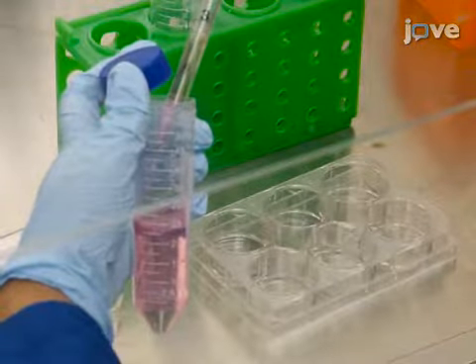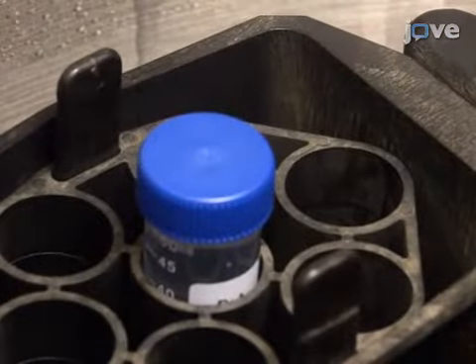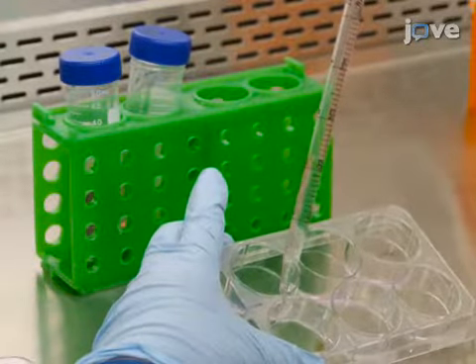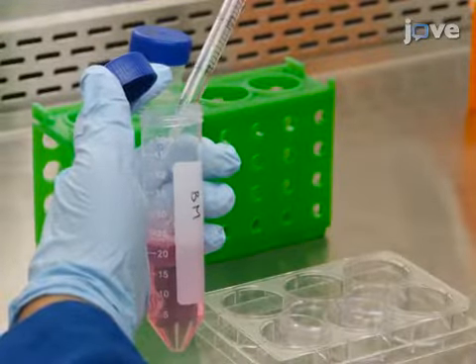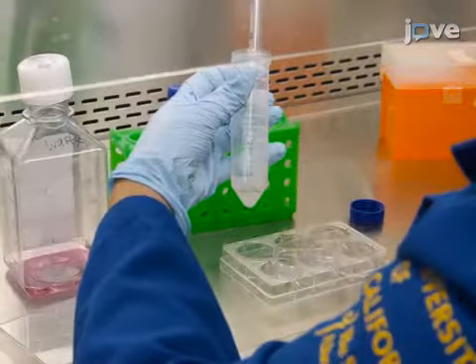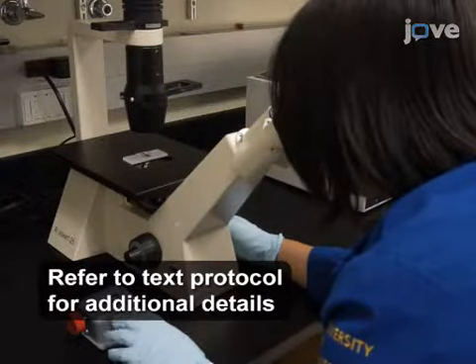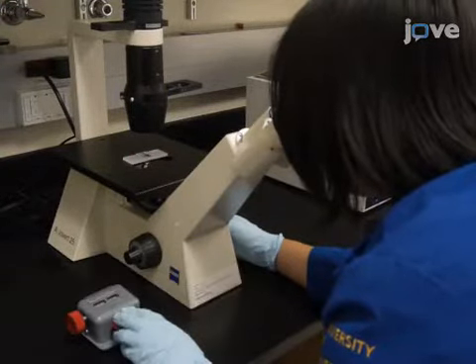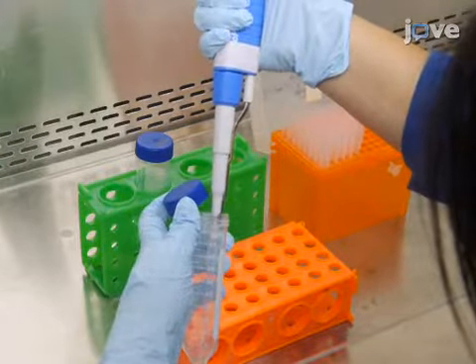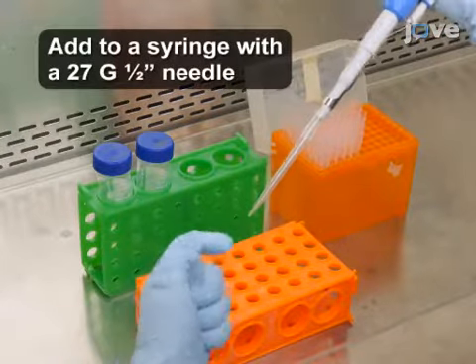Then add the cells to the respective tubes and pellet at 400 times G and 4 degrees Celsius for 10 minutes. With PBS, wash the cells again. Then, after spinning, use 5 milliliters of PBS to resuspend the cells, and count them using trypan blue exclusion and a hemocytometer. For injection into mice, resuspend 5 times 10 to the 5th through 2 times 10 to the 6th cells in 50 to 100 microliters of PBS.